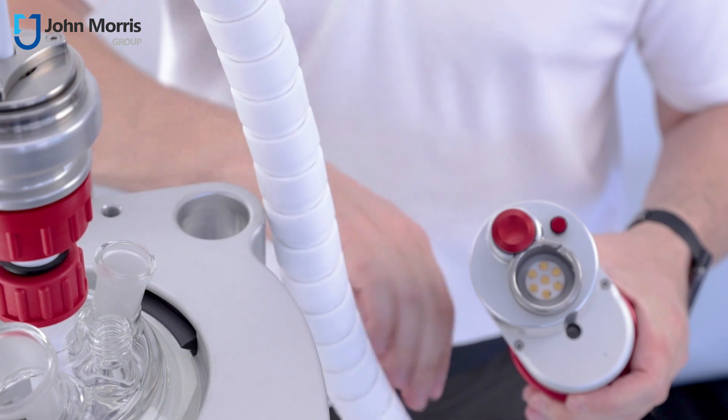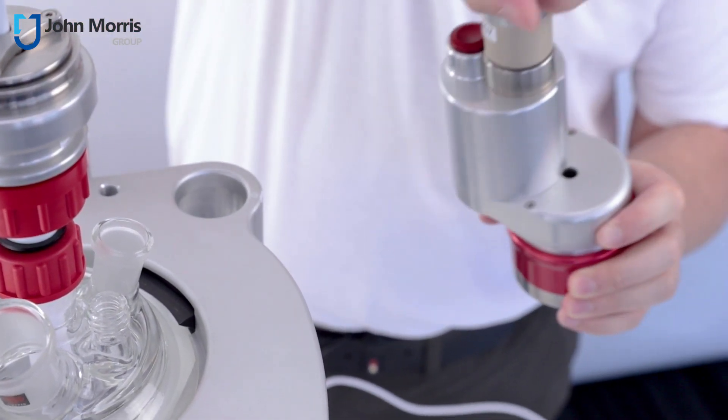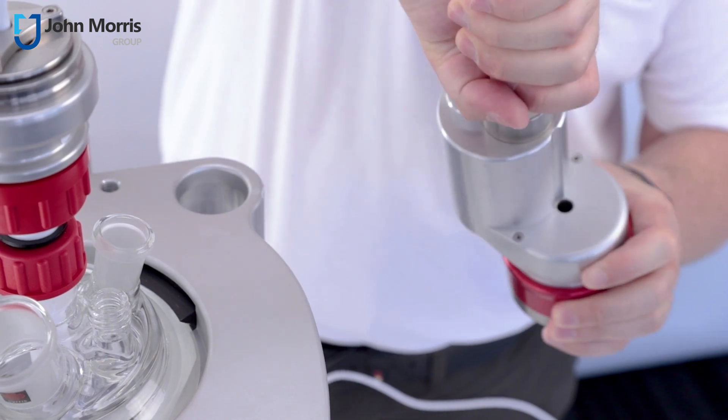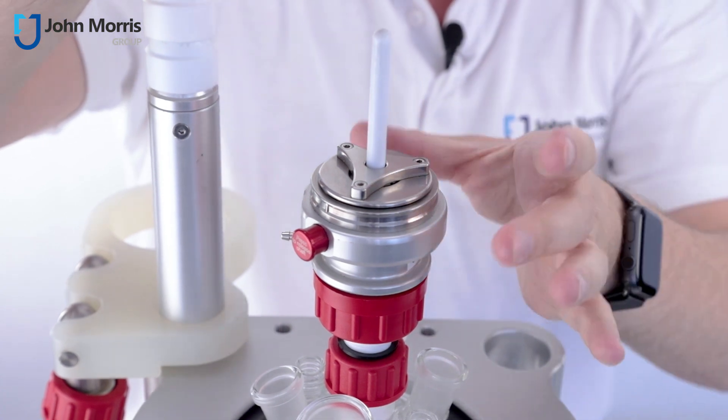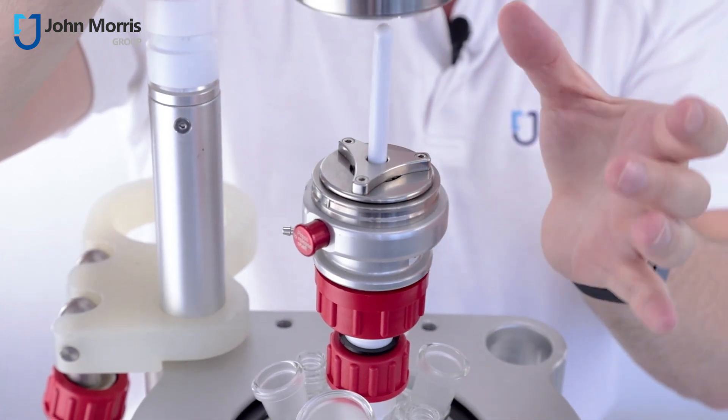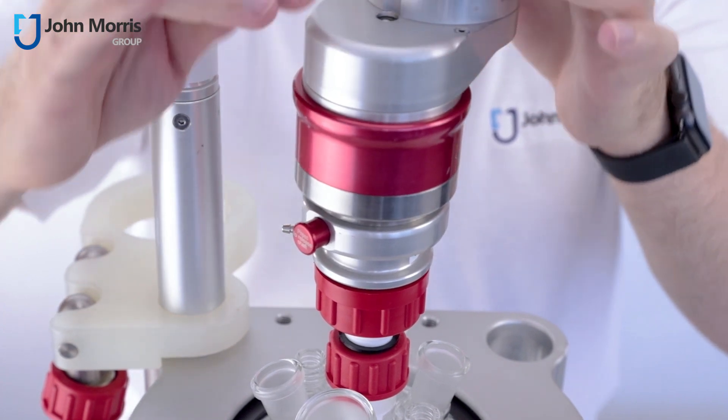Now we're going to connect the drive. Listen for the click and away we go. So the motor goes straight over the top and it's all auto-centering so you don't need to worry, again no tools, and here you go, listen for the click.